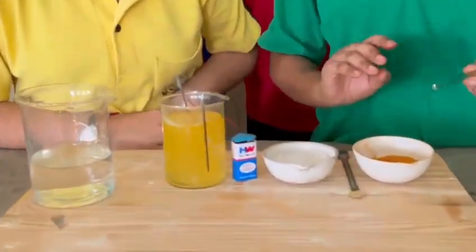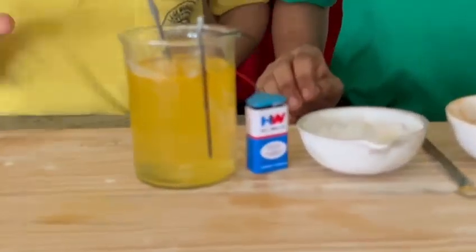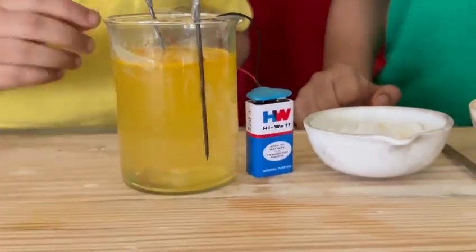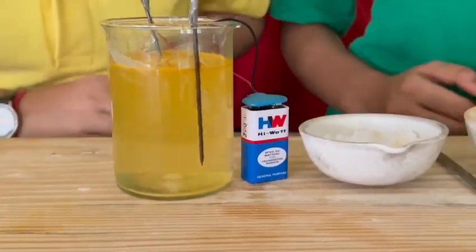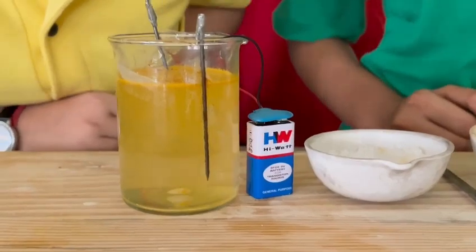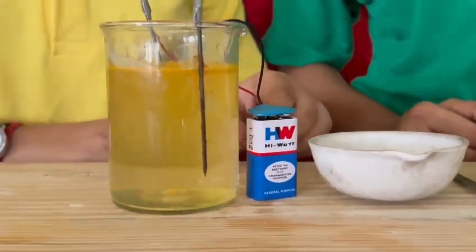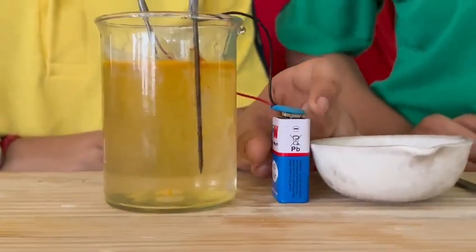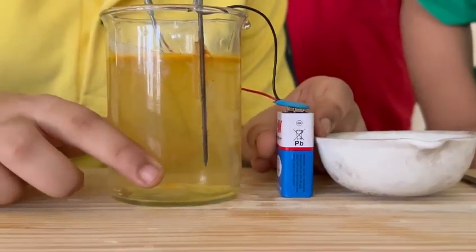You will observe that the color of the solution changes to yellow. You can also observe chlorine and hydrogen gas being liberated at the anode and cathode respectively. Now, just keep observing the solution.